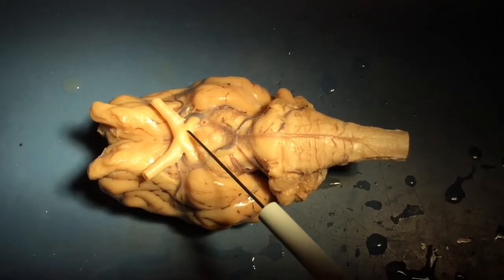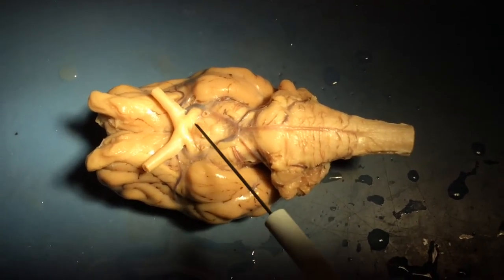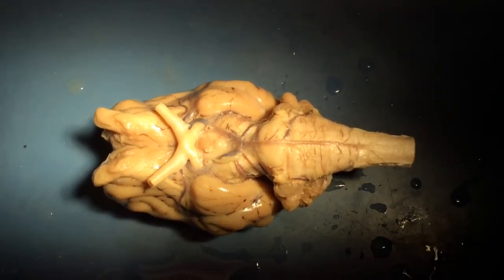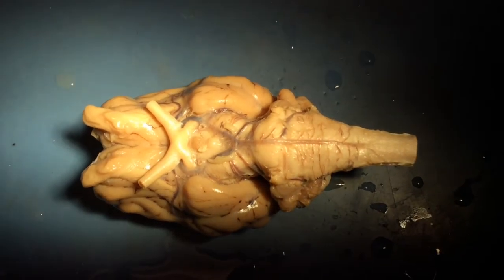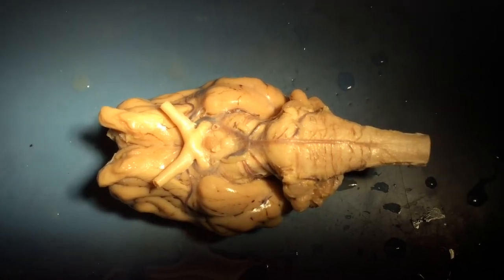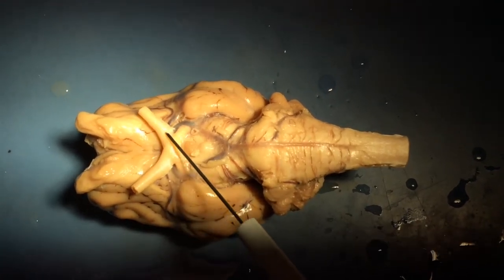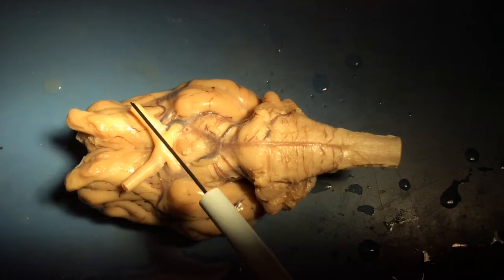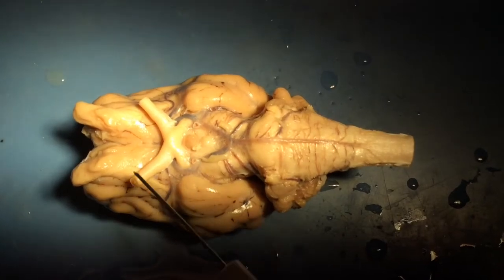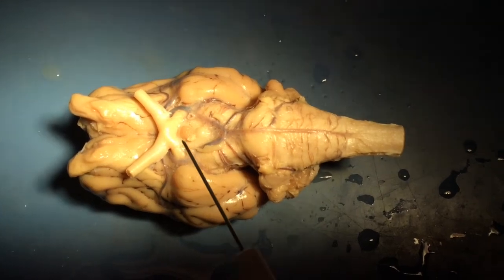You also notice that the optic nerves seem to travel over one another and back into the brain, forming an X. And in fact, early anatomists were impressed with this X and called it the optic chiasm. Chiasm is basically a word that means crossing or X shape. So that whole structure there, the optic nerves, feed into the optic chiasm. In reality, only some of the axons from, say, the left eye cross into the right side of the brain. Half of them will stay on the same side, but it does form this X-like structure on the ventral surface of the brain that's right beneath the hypothalamus.